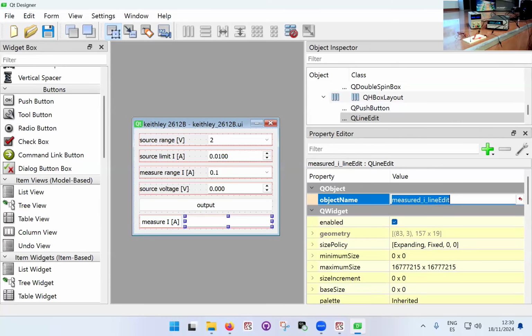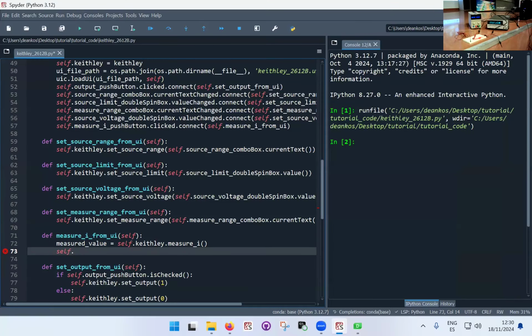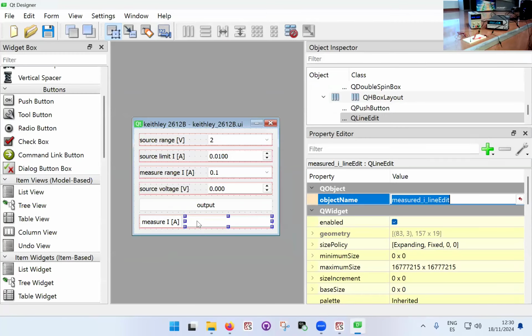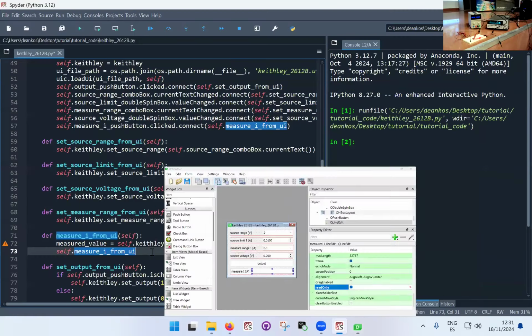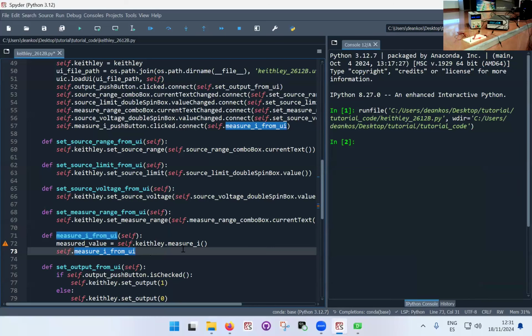Now this box, because we're only using it to print a value, we don't need to connect it to anything. This is not supposed to trigger anything. I mean, touching this box, it's just a display box. In fact, what we can do here in the options is to enable the read-only checkbox. So the user will not be able to type anything in this box because anyway it would be overwritten, but since it's a function it's not needed, better remove it. So measure I from UI.